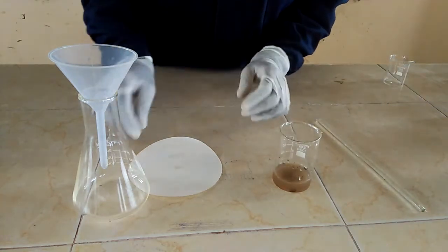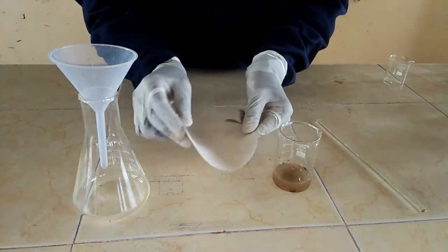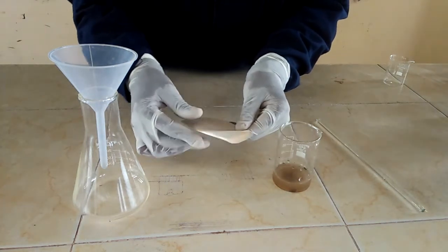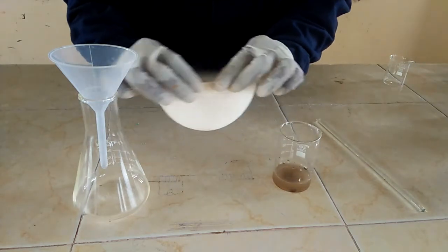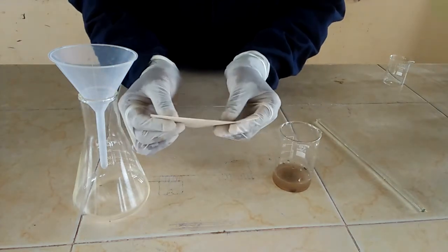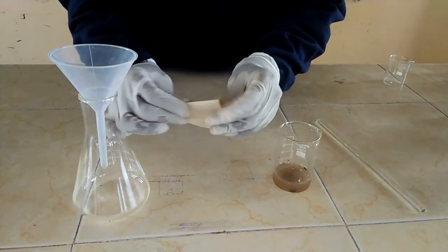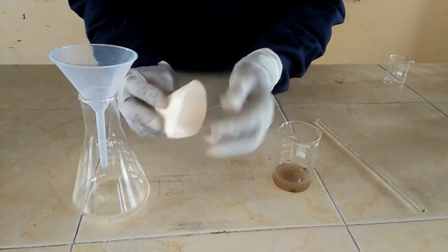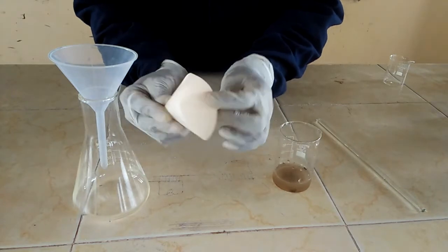So what am I going to do first? First of all, I'm going to make a cone in the filter paper. So you fold your filter paper into a cone, then make a cone. So I have my cone — a very good cone.